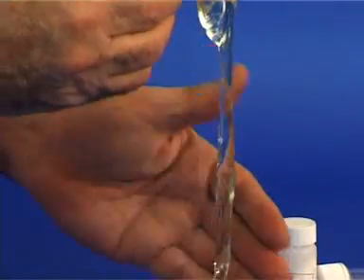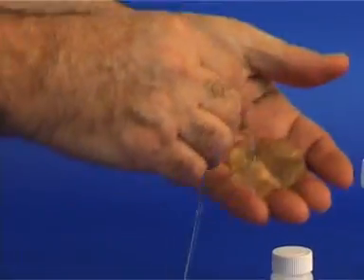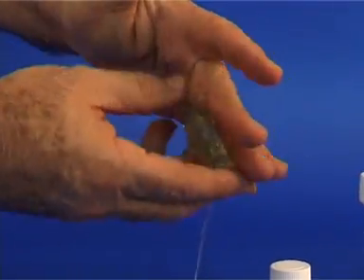Take the viscous substance out of the reaction vessel and hold it in your hands. It is a cross-linked polymer and it is safe to hold.